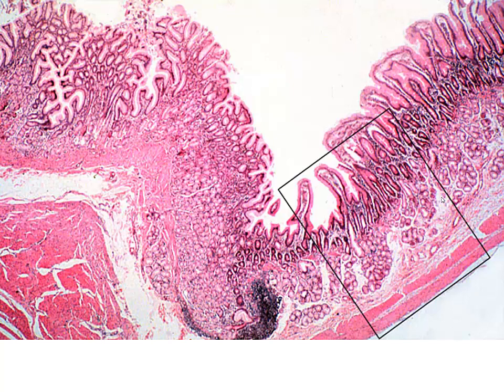Now, looking a little more closely, again, we've got gastric pits and glands, sort of a weird section through this, but you can see how we're moving from our gastric glands, this is pyloric sphincter, and we can see the beginning of the appearance of these mucus-producing glands down in the submucosa, being Brunner's glands.